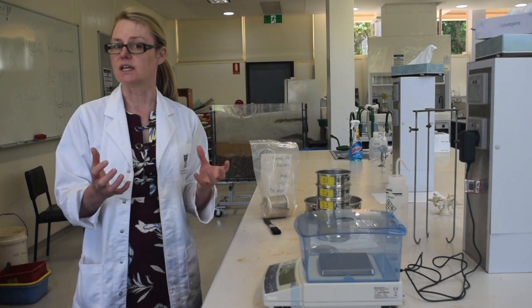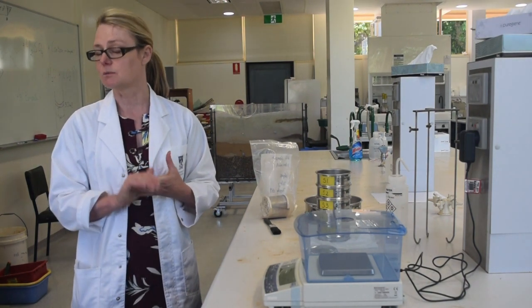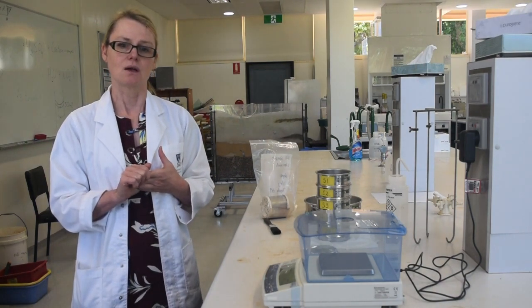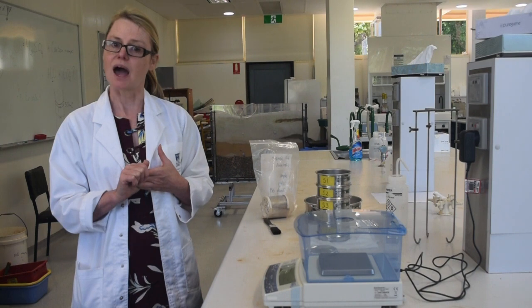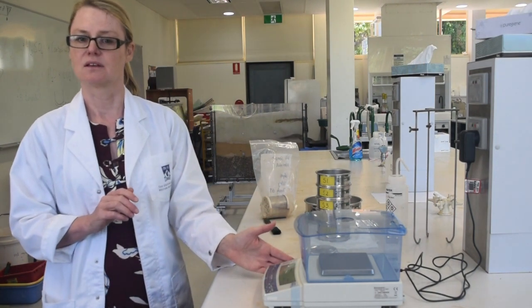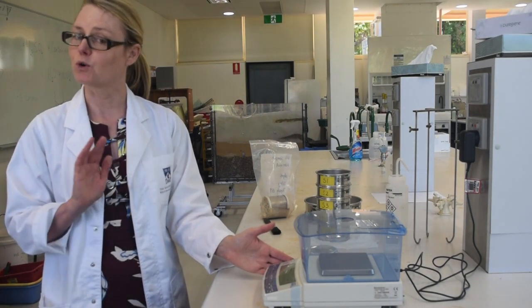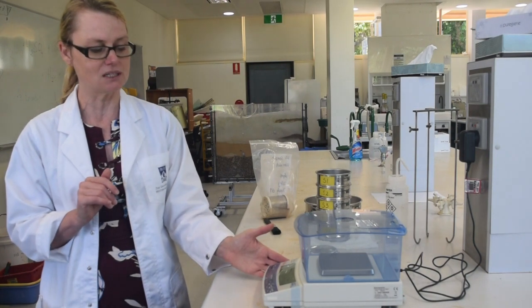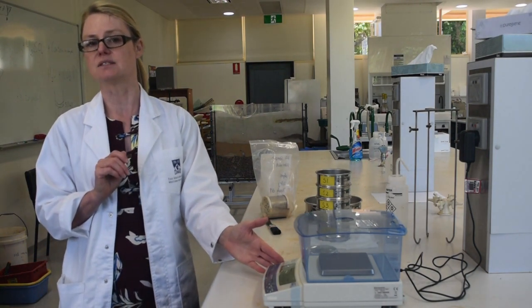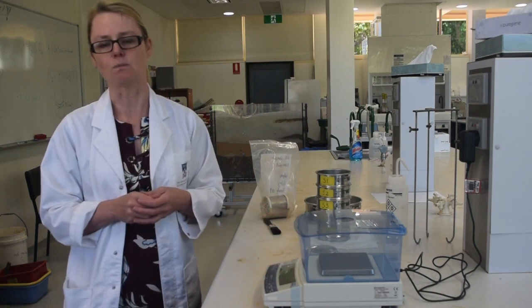Instructions on what you need to do to determine your aggregate size distribution and the stability of those aggregates are provided in the lab manual, but I'm just going to quickly show you some other key pieces of equipment. First of all, there's the balance. You're going to be weighing various things throughout the lab, but before you take any weights, please check using the spirit level on the balance that it is level. This will ensure that you get good measurements.